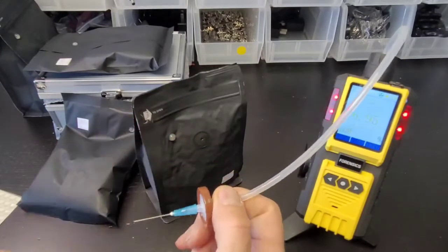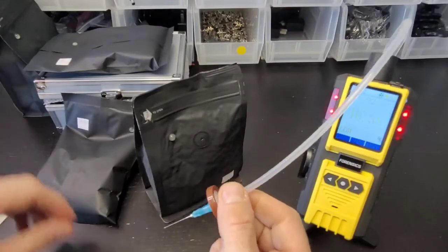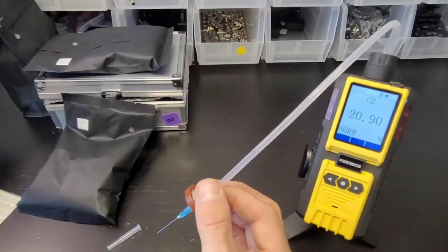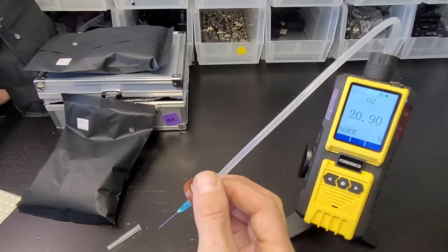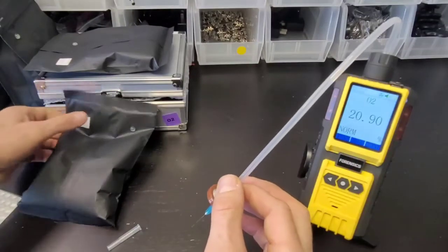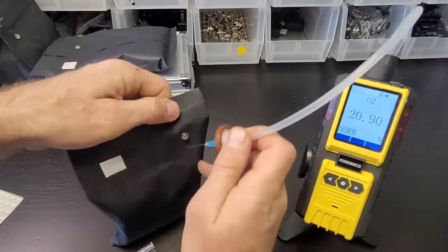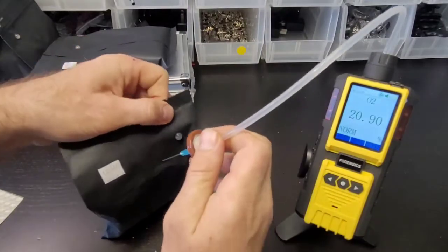Third bag - it's ground coffee, I can feel it. We need the same 20.9, I'm ready to go again.